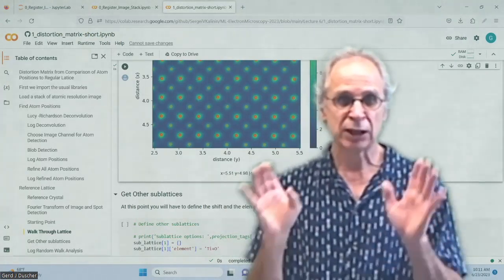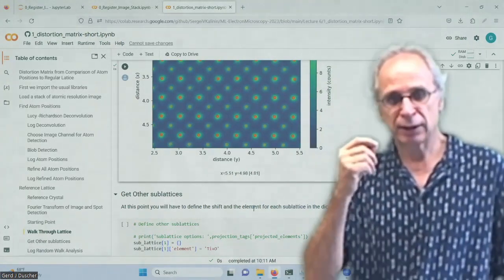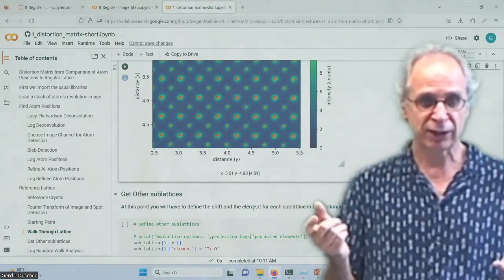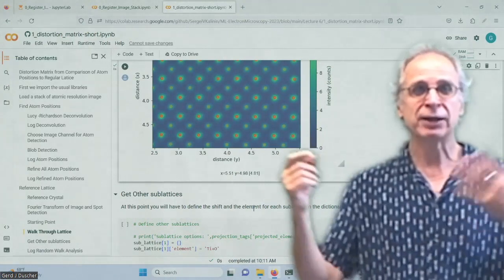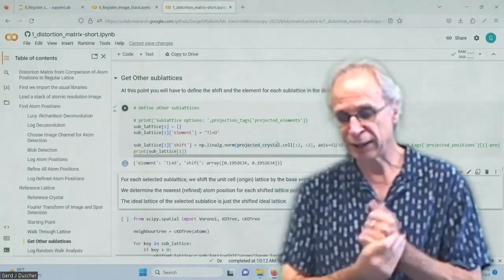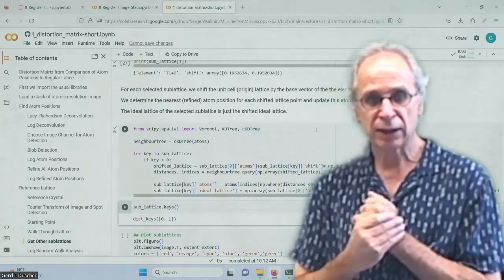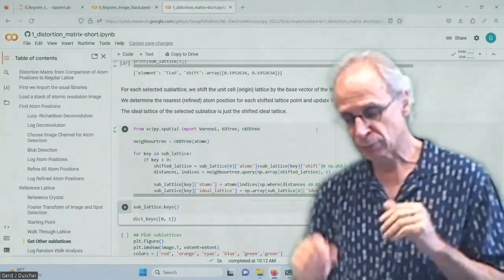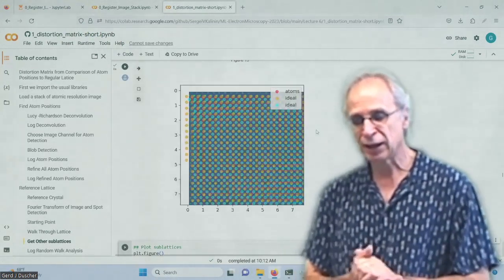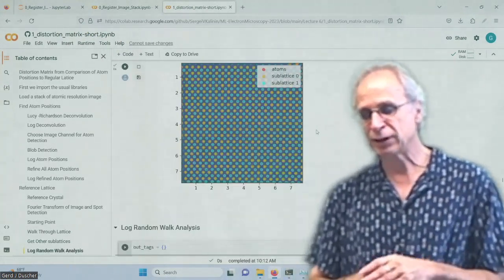I sorted already all the atoms depending on what kind of elements there should be. And now I can make histograms of these atoms, intensities. I can see whether one is missing or not. So I have all the tools already in hand here. What I'm doing is I'm making this sublattice and store them. And then I determine how much the refined position is from where it is supposed to be. So now I have two sublattices, and that are my ideal ones. So they are far off, obviously, but I also have the ones that are perfectly aligned.